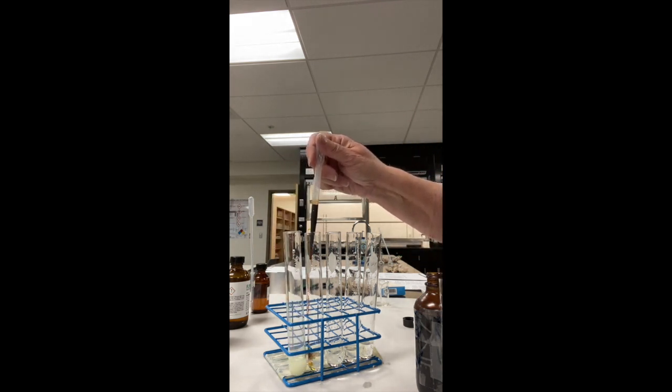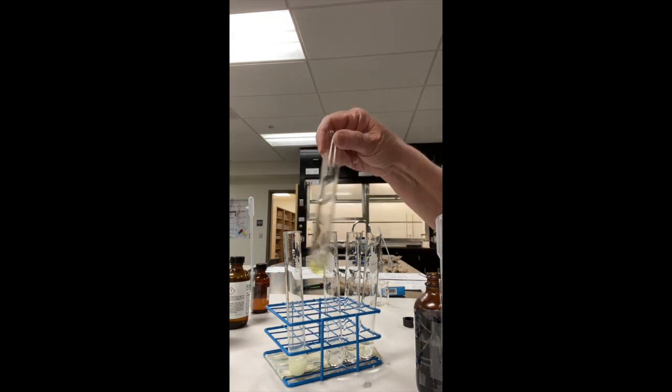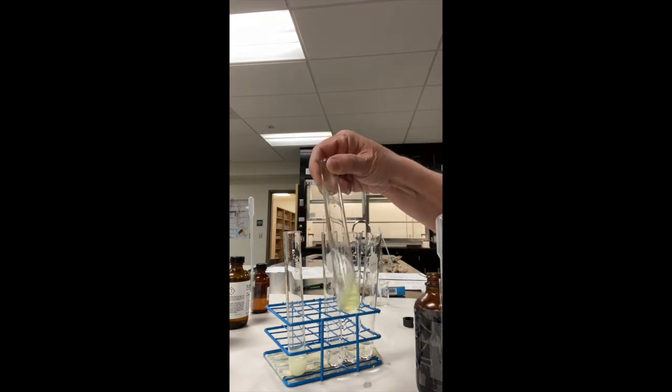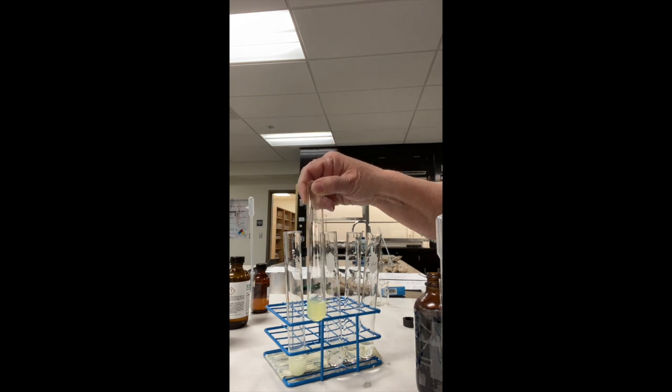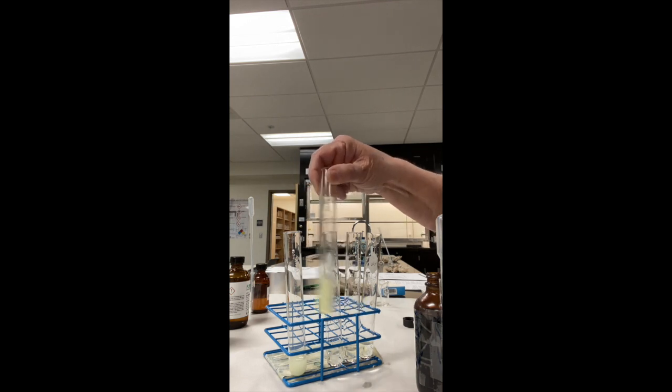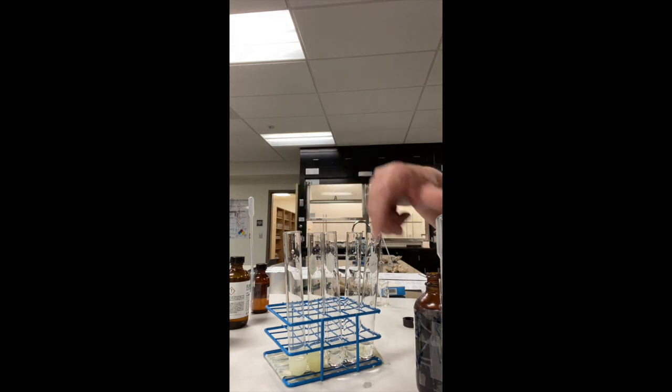Let me add a few drops of iodine here. This is the second one. This is the isopropyl alcohol or propanol. I do have a little bit of yellow in that one.